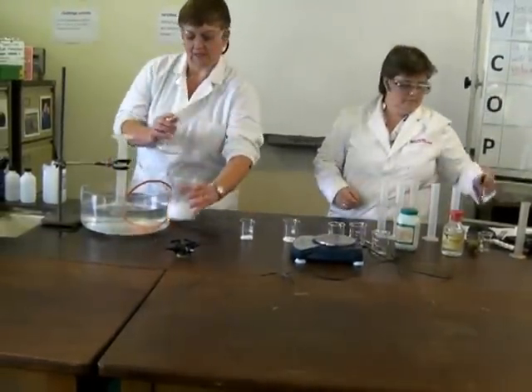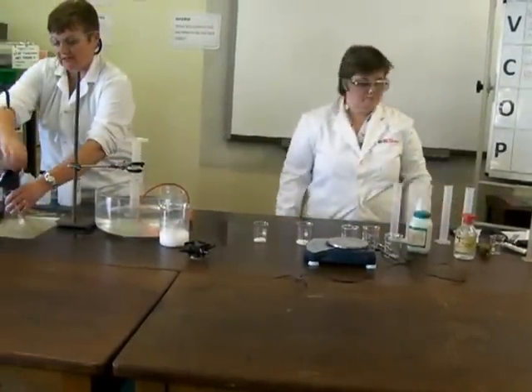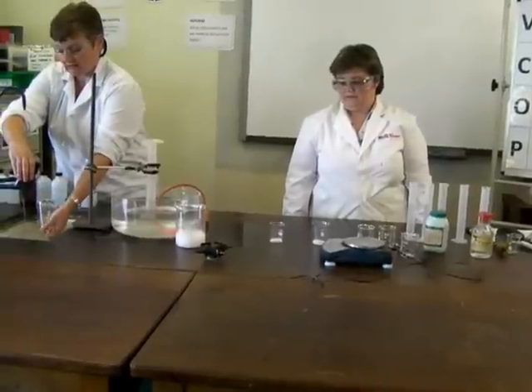Try not to block up the sink, and I'm trying not to splash any acid either, because that's quite a risk if you get it on your hands. It's a bit of an irritant.